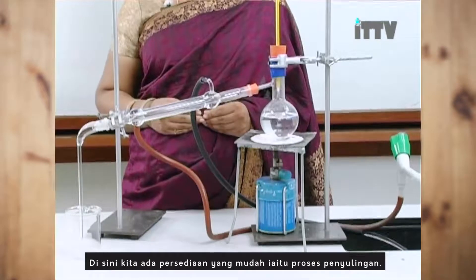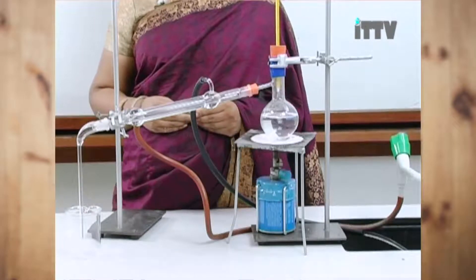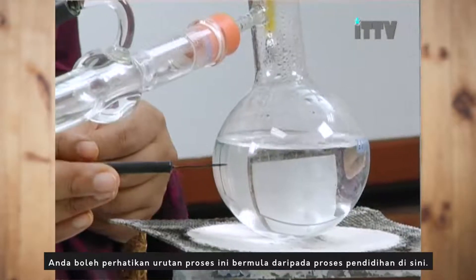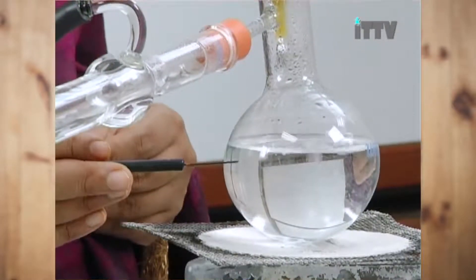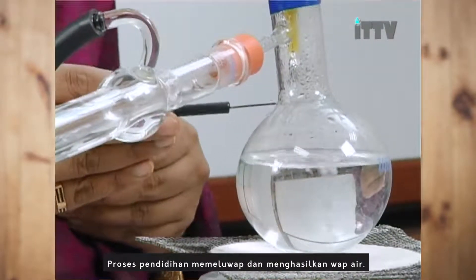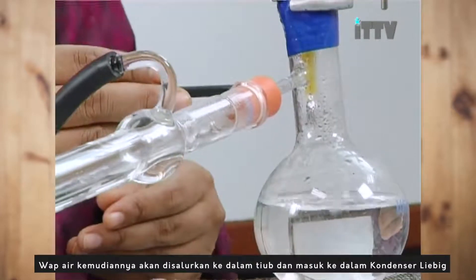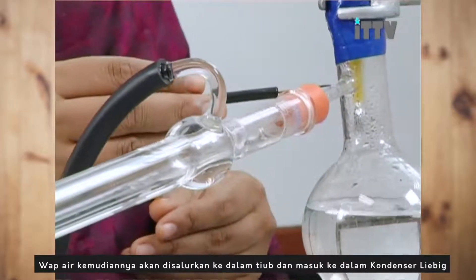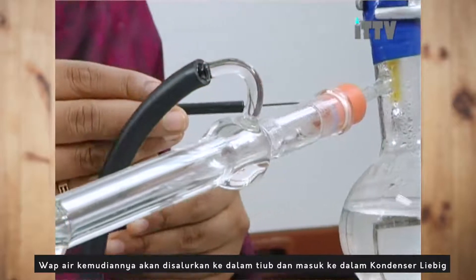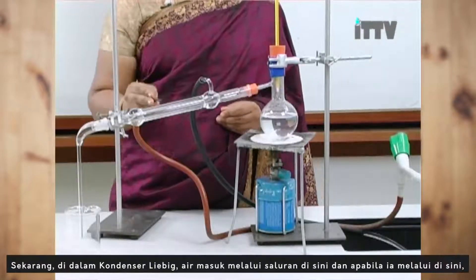In here is a simple setup for a distillation process. You can see the sequence actually starts from the boiling process in here. The boiling process actually evaporates and creates steam. This steam is then channeled into this tube and goes through this Liebig condenser.